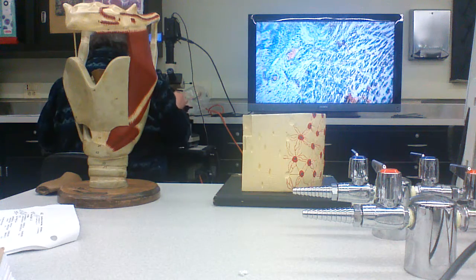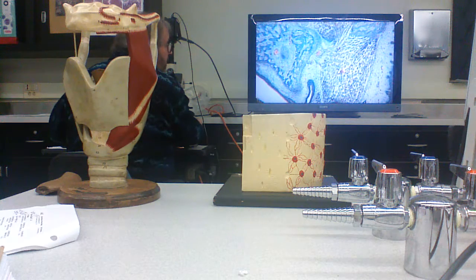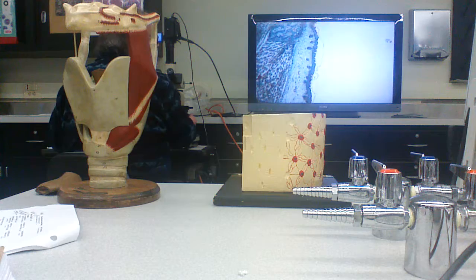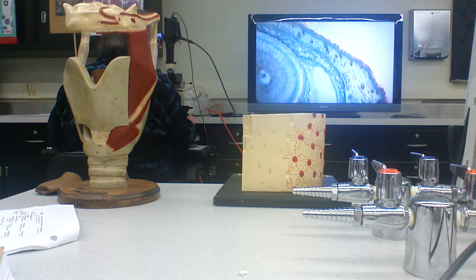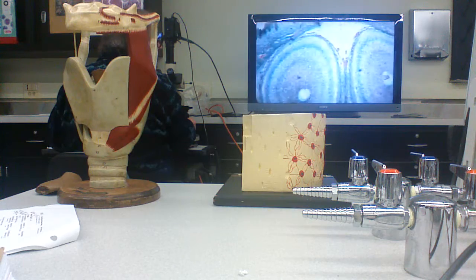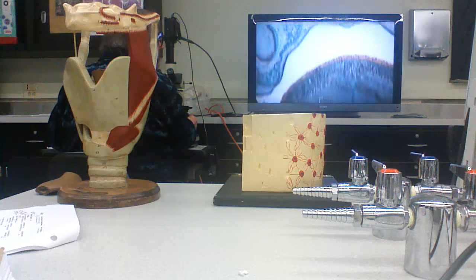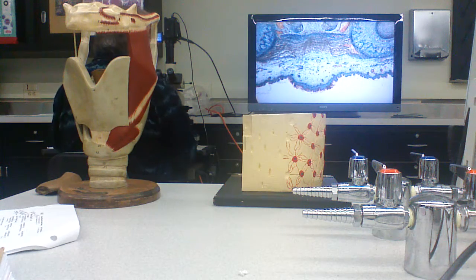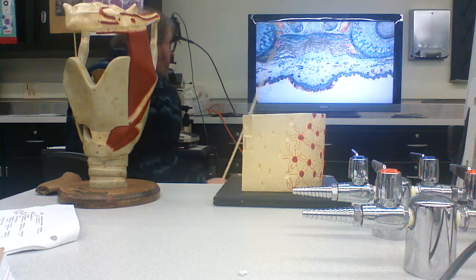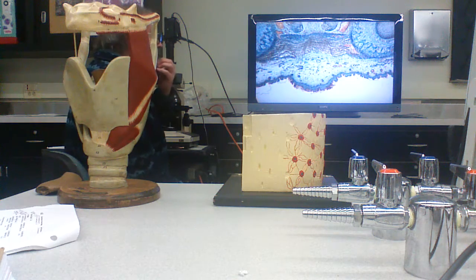And let's try to orient ourselves. All right. So, again, this is the head of the embryo, and it's developing here. Here's the mouth. This is a rodent, so the jawbones of a rodent don't fuse together.